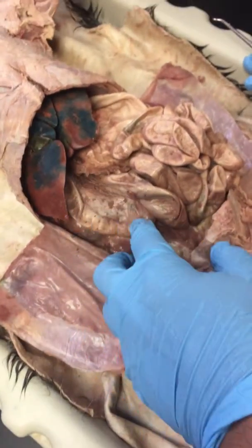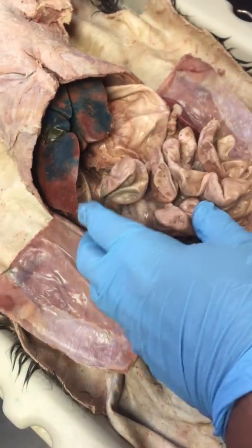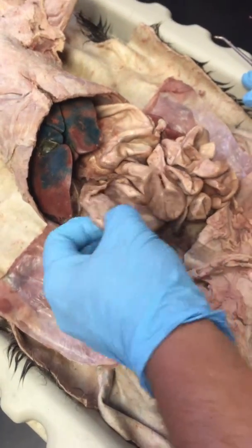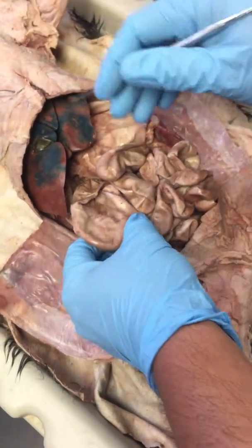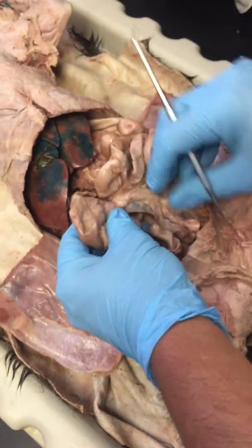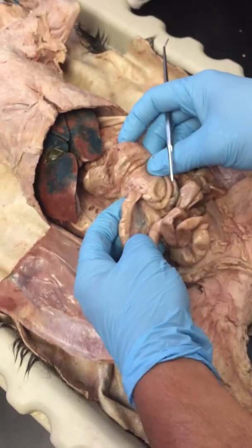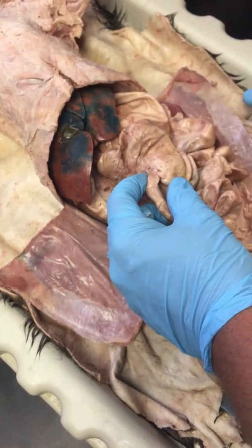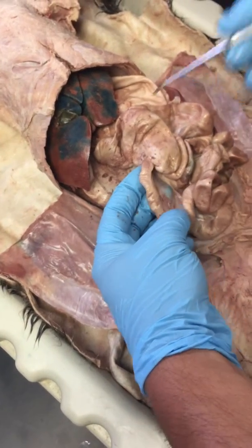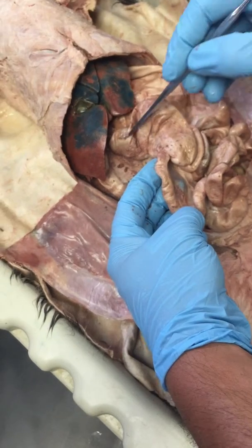Okay, so the first probably 3-4 inches maybe. Okay, then the next couple of inches, next few inches, is the jejunum. Okay, now here's the confusing part. It's really hard to separate the jejunum from the ileum. The ileum is the end of the small intestine. Okay, but what I'm going to do, and I'm not interested in tricking you guys. Okay, so this is obviously the end of the small intestine and the beginning of the large intestine.